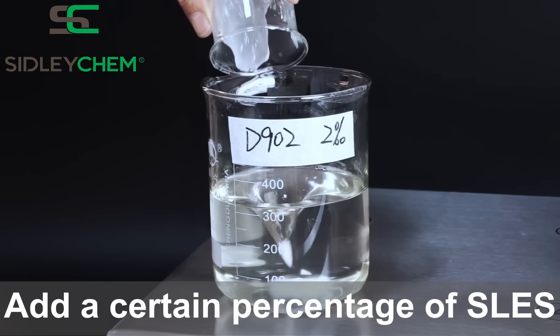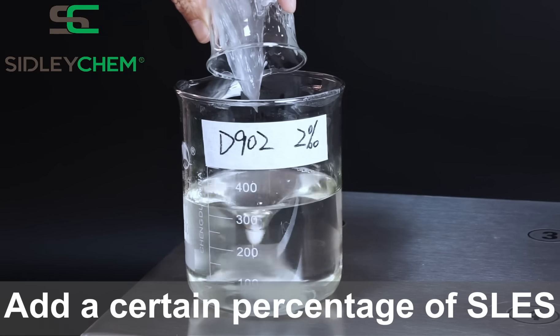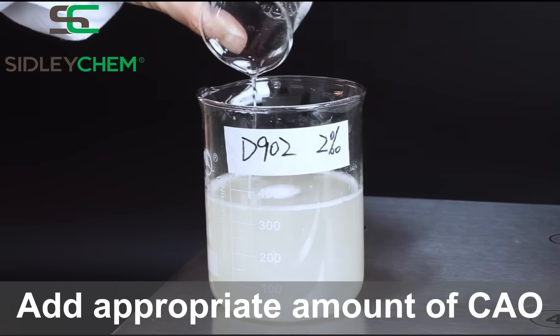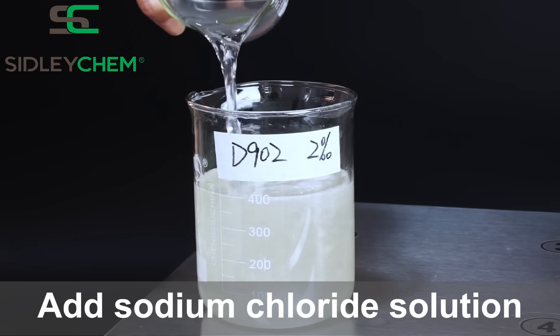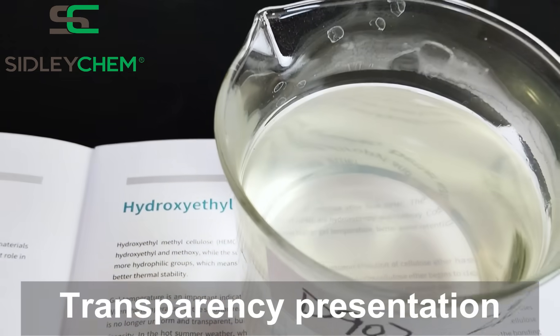Add a certain percentage of SLES, add an appropriate amount of CAO, add sodium chloride solution, and perform a transparency presentation.